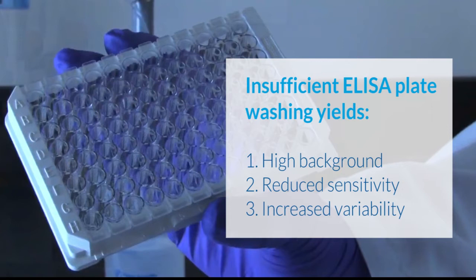Insufficient washing is a common cause of high background, reduced sensitivity, and variability in immunoassays.